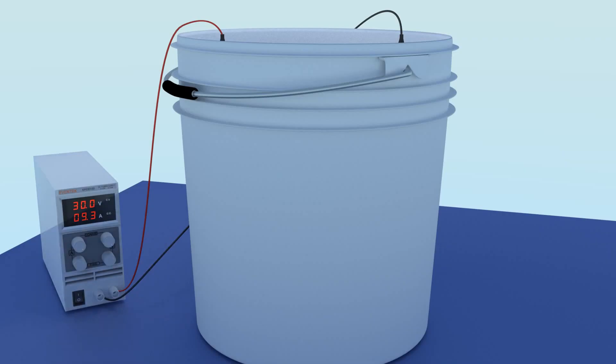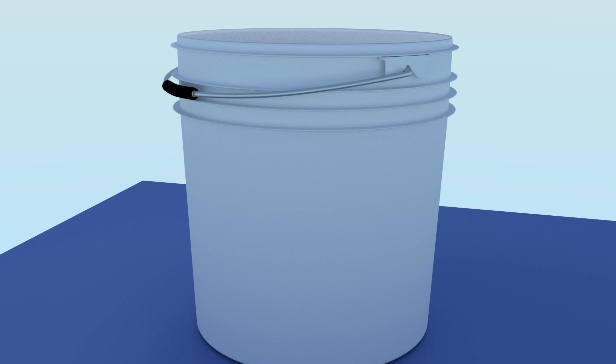This is what you will need. A bucket, or other plastic or glass container.